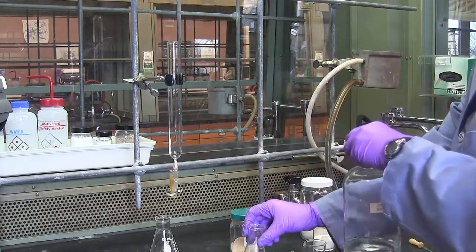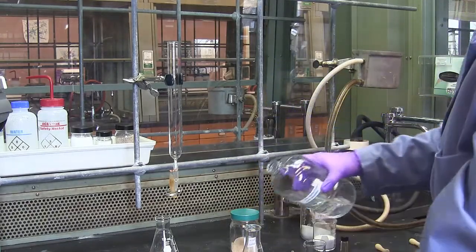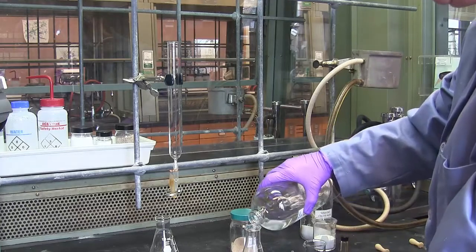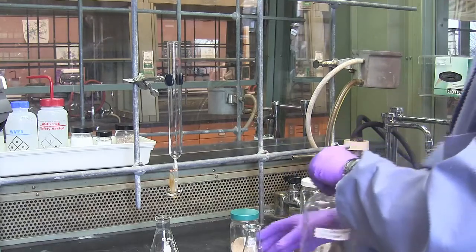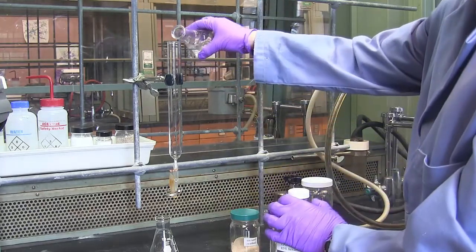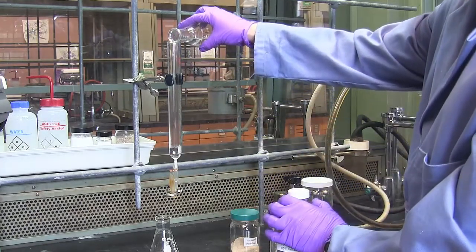I have some eluent that I will transfer to a smaller flask. I'm going to pour about 4 inches of eluent into my column.